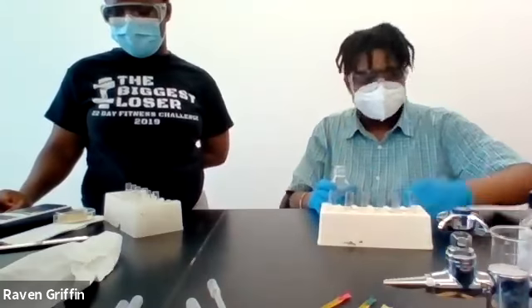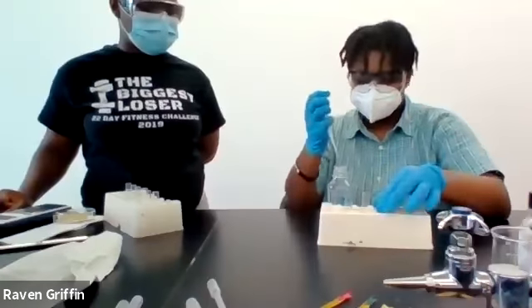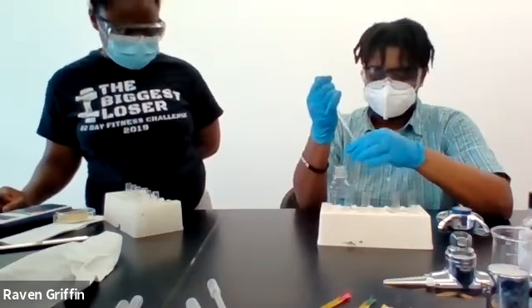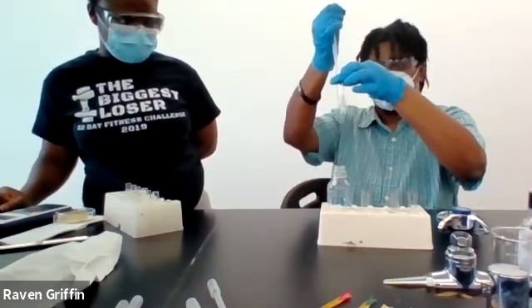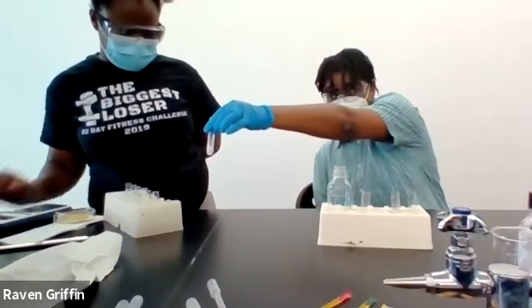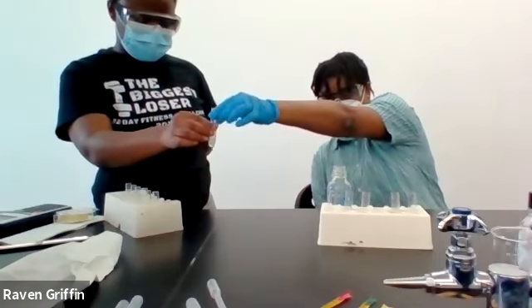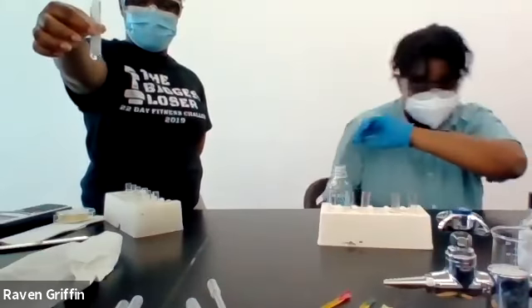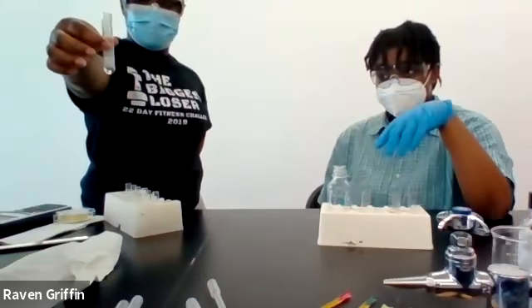Yeah, so now the sulfuric acid, 3 molar. So first with the magnesium. Once again, immediate reaction. The gas coming out.